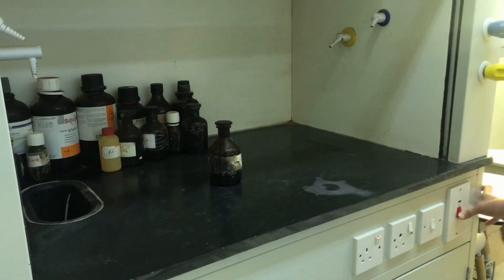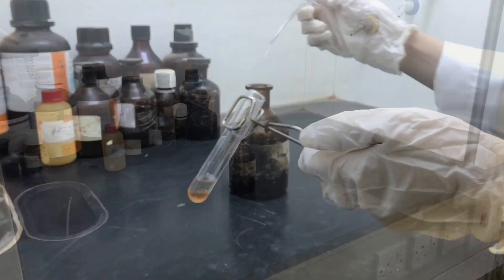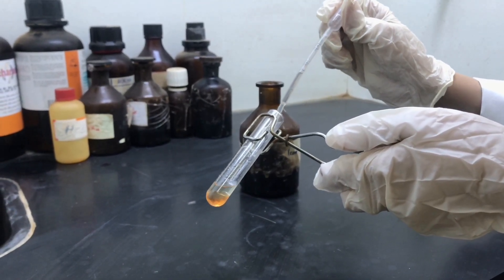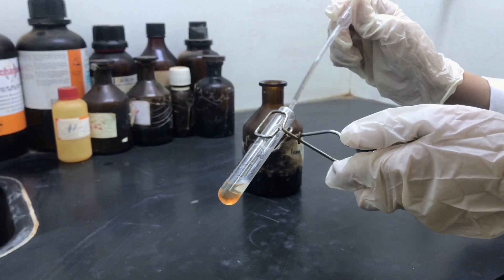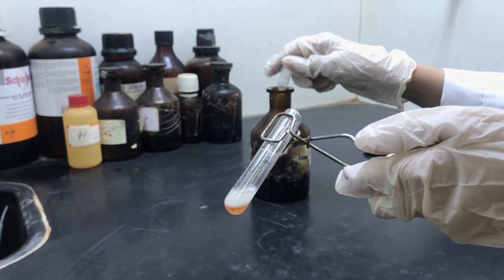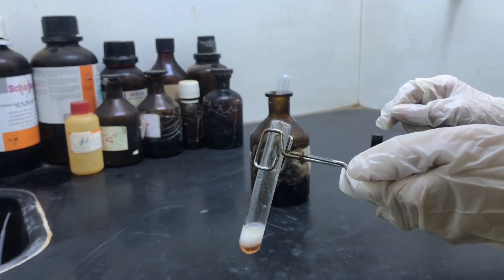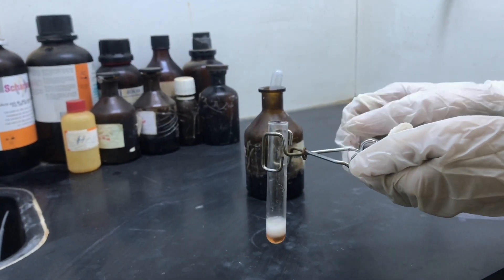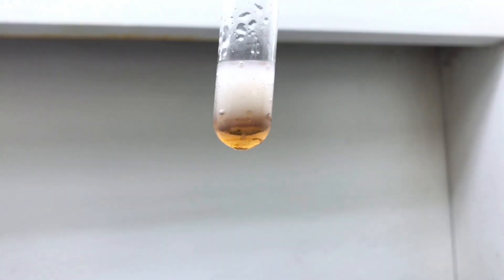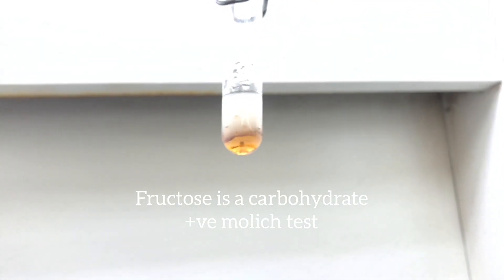Take the rest of the experiment to the hood as we're going to use concentrated sulfuric acid. Hold the test tube at a slanted angle with the clamp, making sure you're holding the clamp from the edge. Then add one mil of concentrated sulfuric acid very slowly. When the sulfuric acid drips down to the bottom, start to straighten the test tube very slowly. You're going to observe a violet ring at the junction of the two liquids — the presence of the ring indicates the presence of carbohydrates.